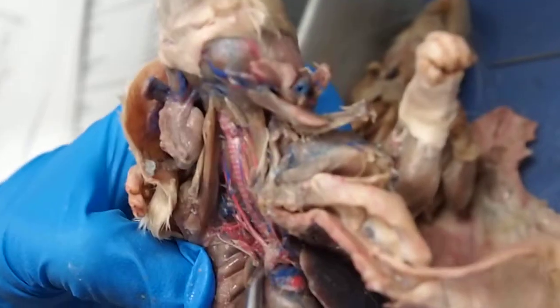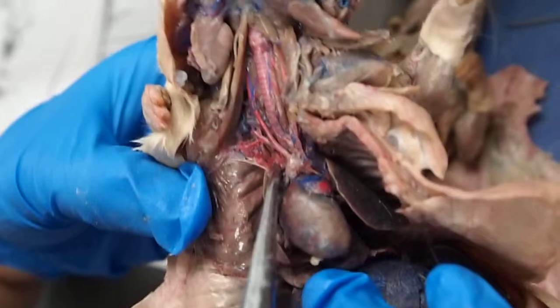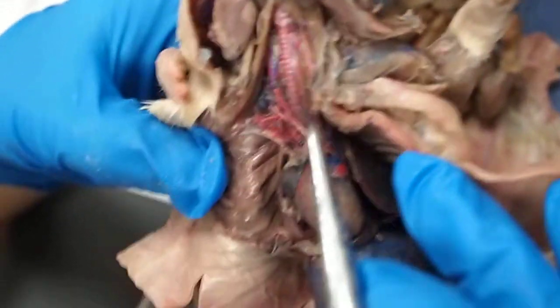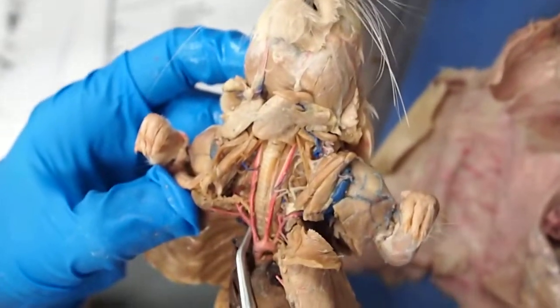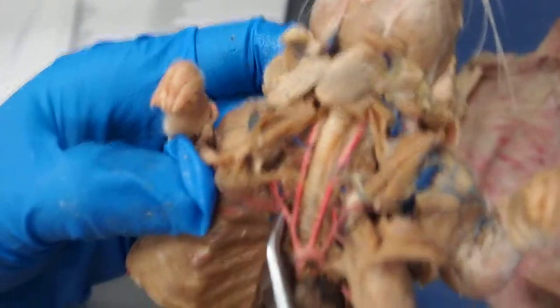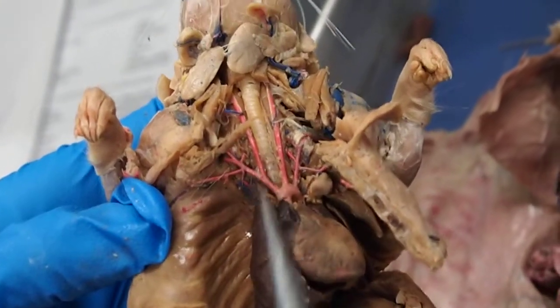So, maybe not. Basically, the ones going down are costocervical and internal thoracic. Let's see if you can see it on this one. Yeah, it's not really good on either one. But if you see two arteries going down this way, the one on top is going to be the internal thoracic, and the one underneath will be costocervical. So they're both kind of damaged. I would say that this is the costocervical right here, that tiny little one. Usually there's another one that goes along with it.